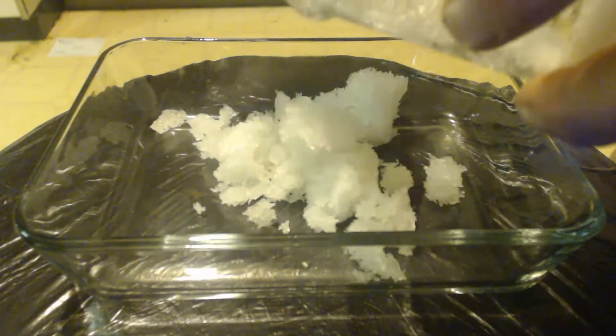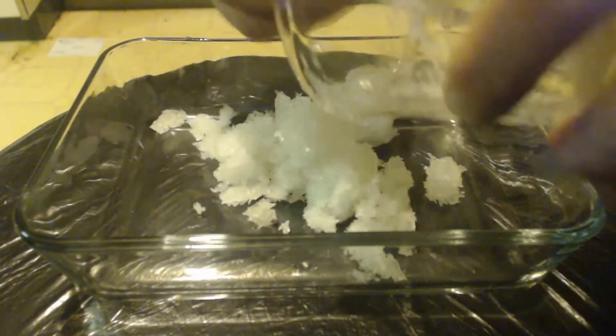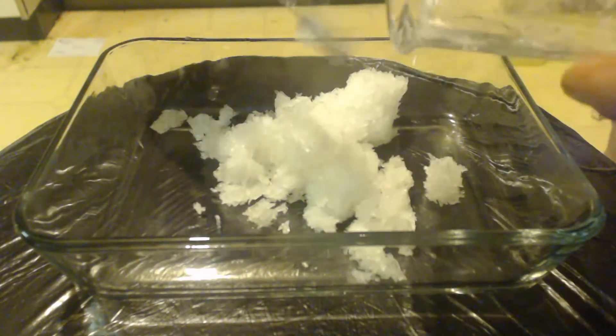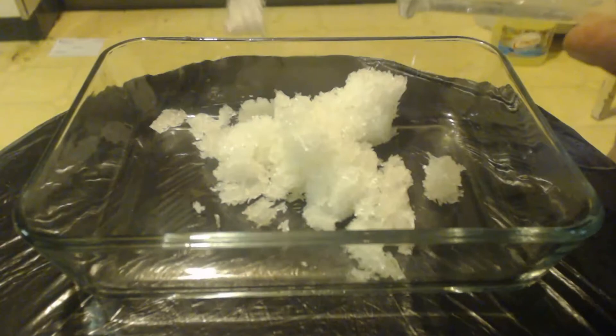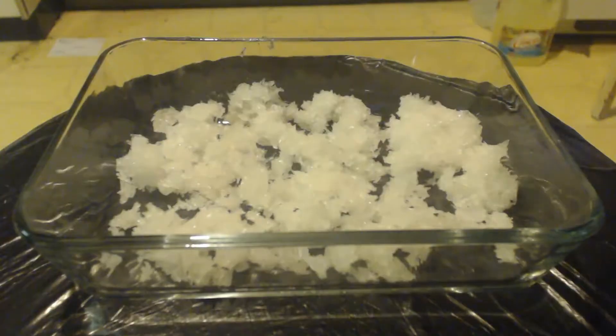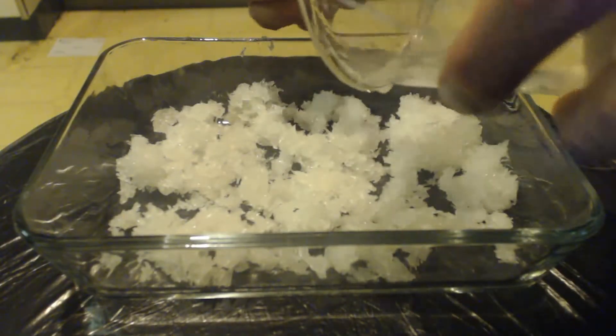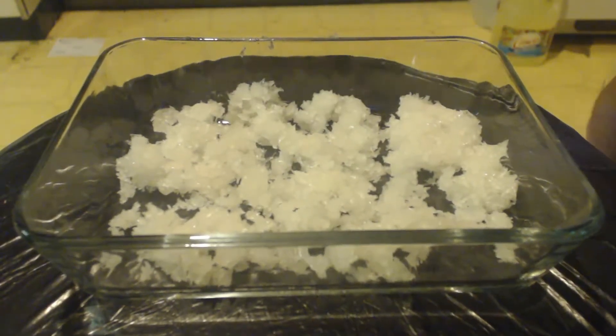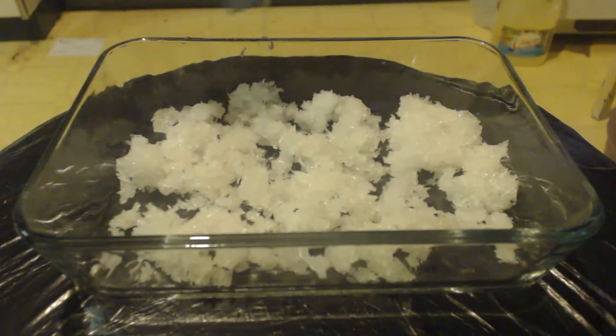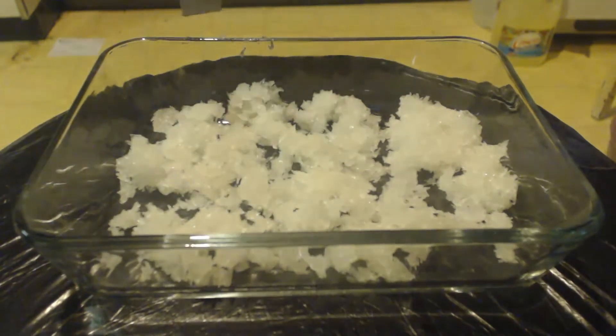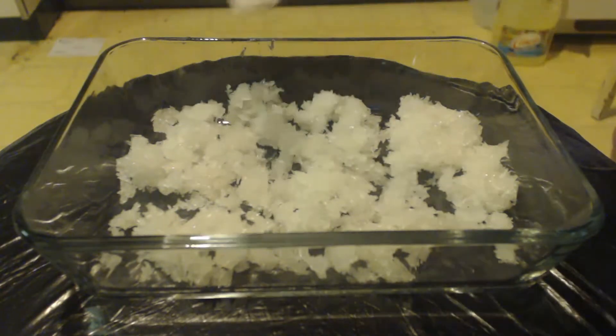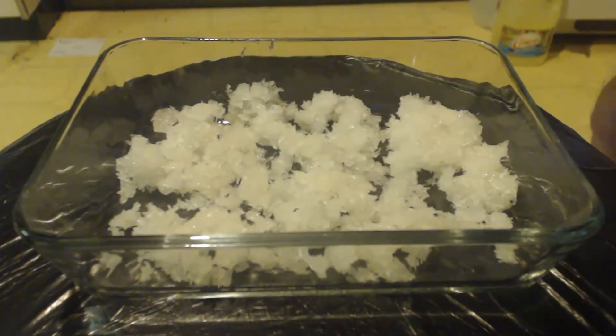Remember, don't eat this. If this hydrochloric acid wasn't store-bought at Lowe's, instead I bought it or made it in a lab, there would be no contamination whatsoever. But because of that hydrochloric acid, I have a loss here now.